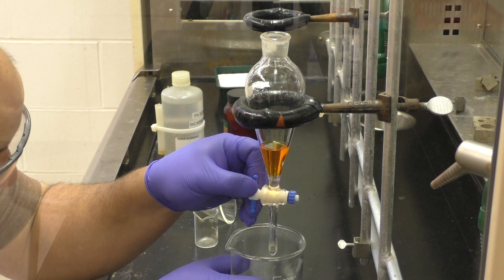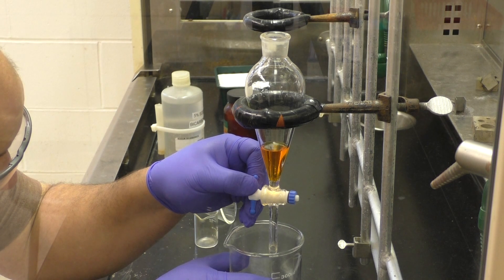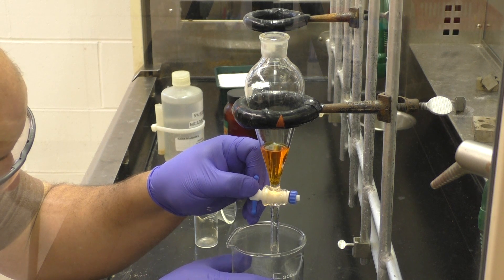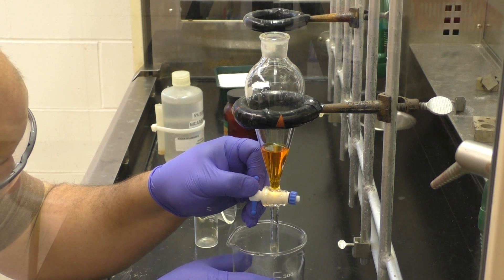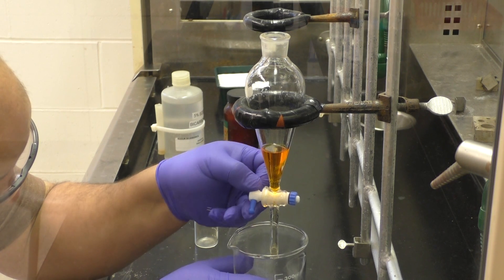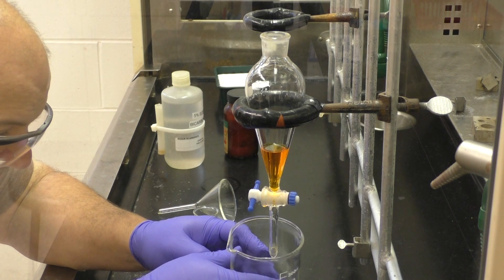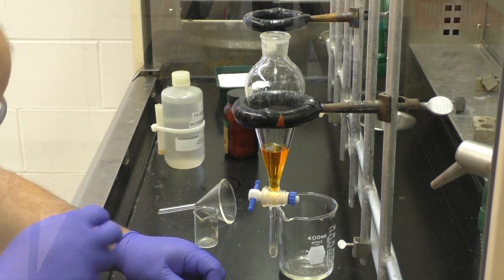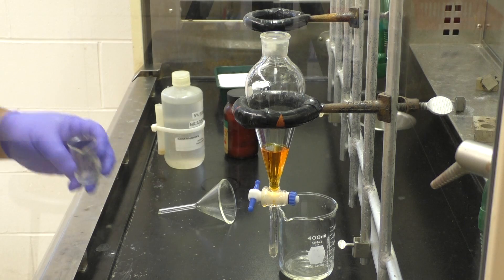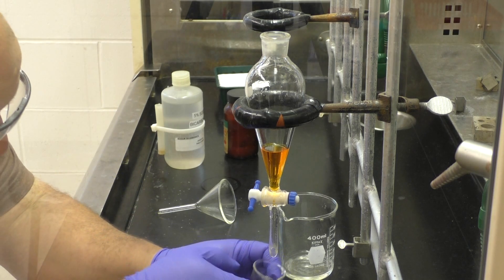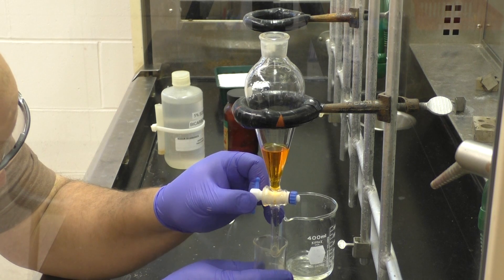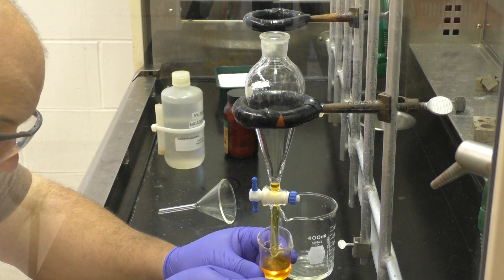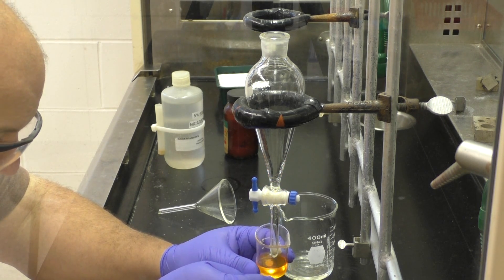Every layer that you have, everything used to run off, is composed of what you started with. And so, to just dispose of it, when you know that it's still there somewhere, is dumb. Anyway, when you go to run off your second layer, you'll combine it with the original one, and that helps minimize how many total things you're collecting. Every bicarb layer that washed the organic, you combine into one container. Your organic stuff should then go into a new vessel, because, if anything, it's more pure than it was before.